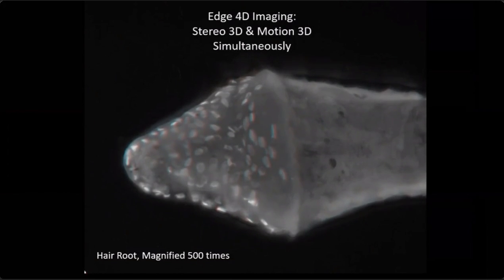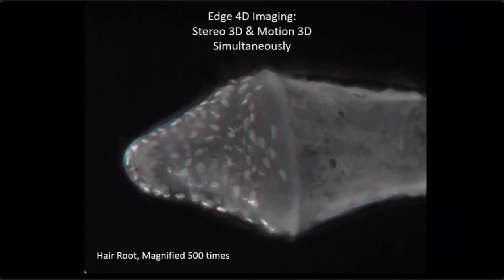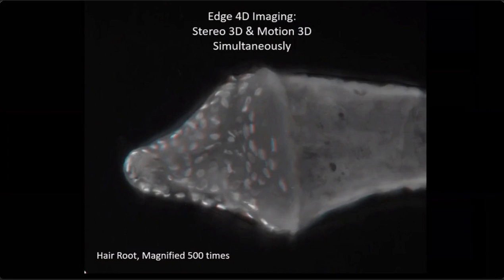You're getting the stereo 3D, which allows you to interrogate the specimen from left and right, but it also allows you to tilt it up and down, so you're interrogating the specimen from different angles. We are unique, and this is a proprietary system.